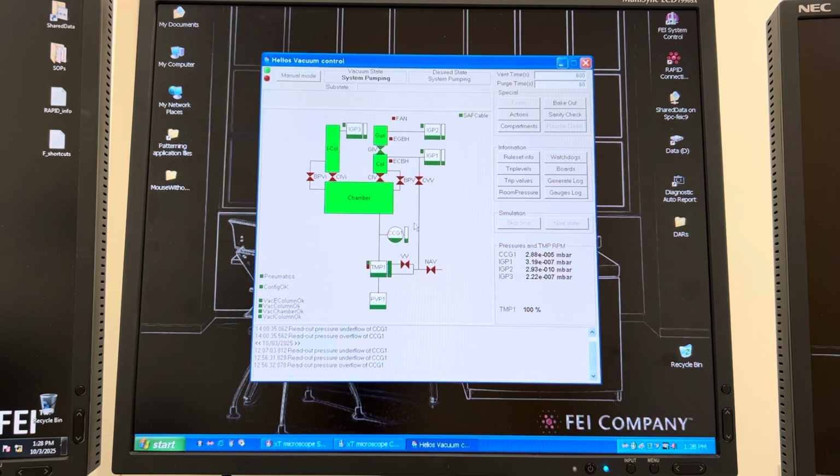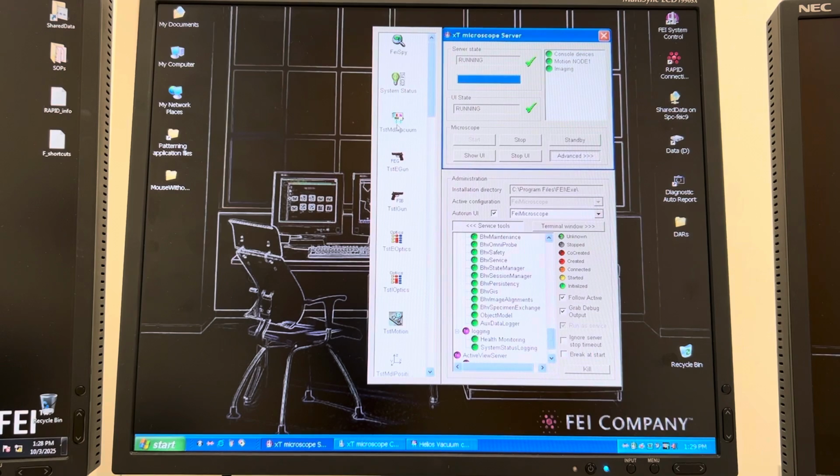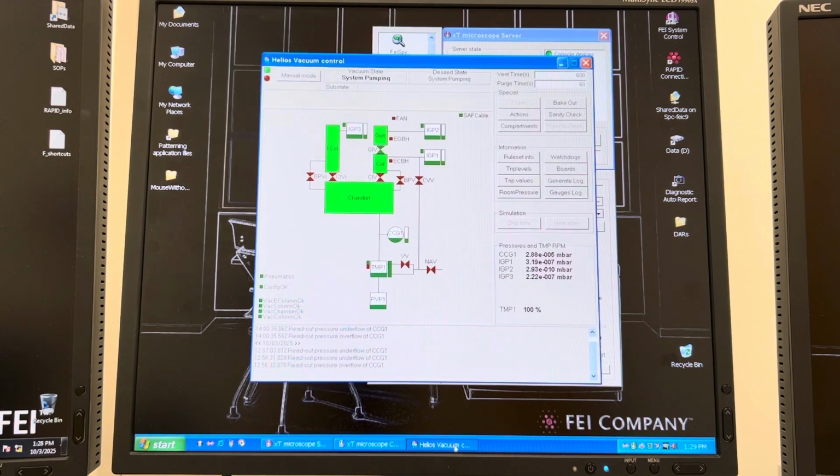So this is the vacuum diagram of the microscope, and this is the chamber. The chamber is pumped by a turbo molecular pump here, TMP1, which is backed by a roughing pump or pre-vacuum pump 1, and then you have a cold cathode gauge which actually measures the chamber vacuum, which you see right here. When you open up this control window, this is a Windows XP system, in your microscope server, you're going to find TST MDL vacuum, and that pulls this up, and you can see the vacuum diagram.